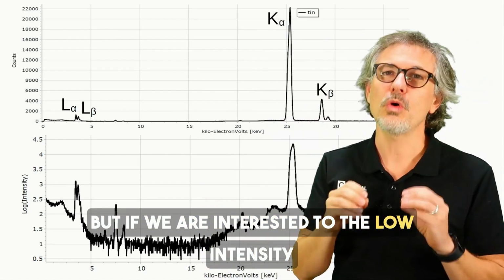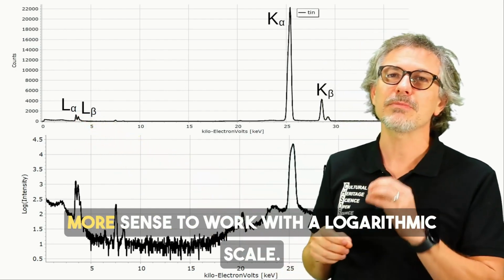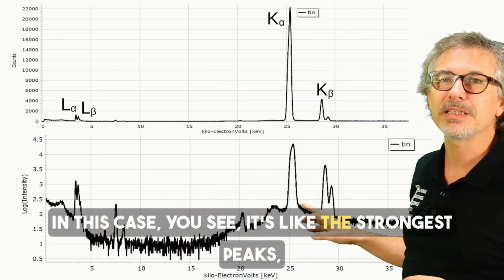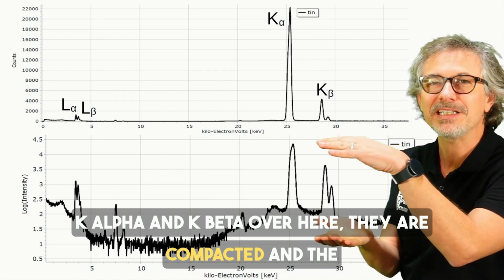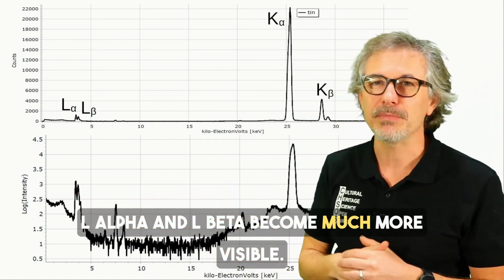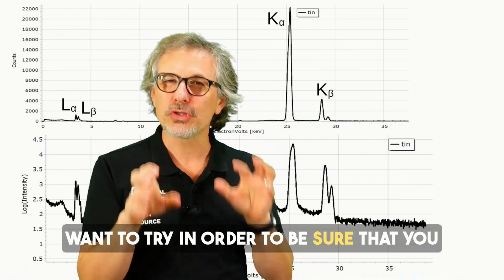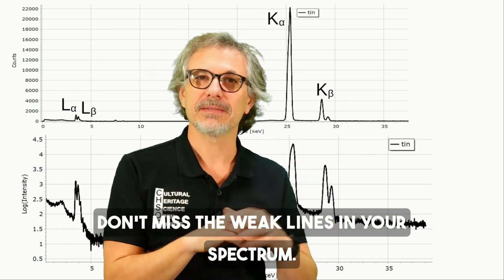but if we are interested in the low intensity lines, like for example L alpha, L beta, it makes more sense to work with a logarithmic scale. In this case, you see, the strongest peaks, K alpha and K beta over here, are compacted, and the L alpha and L beta become much more visible. So this is definitely the logarithmic scale. It's something you want to try in order to be sure that you don't miss the weak lines in your spectrum.